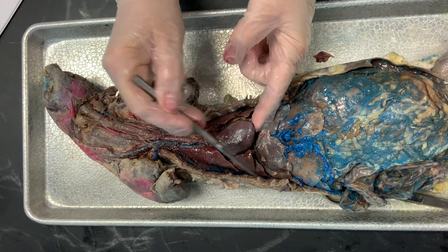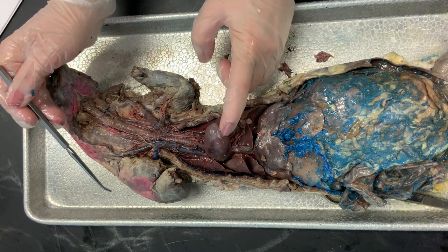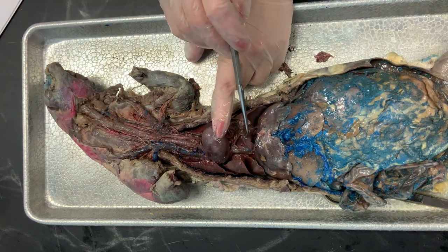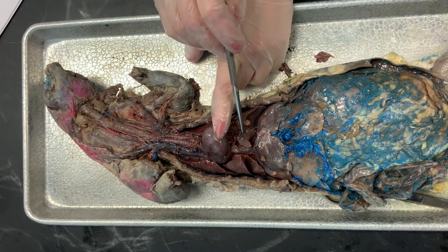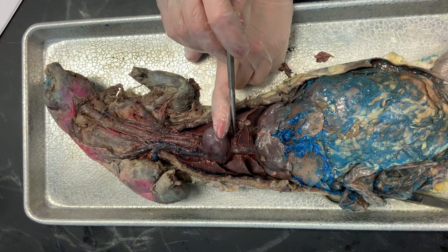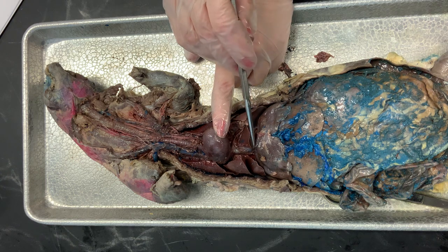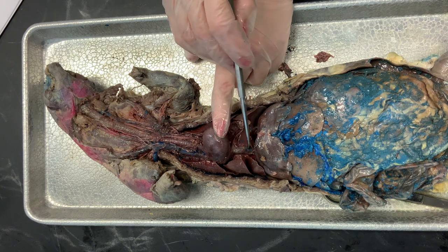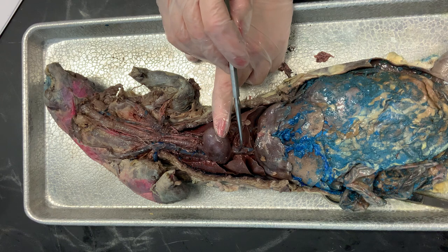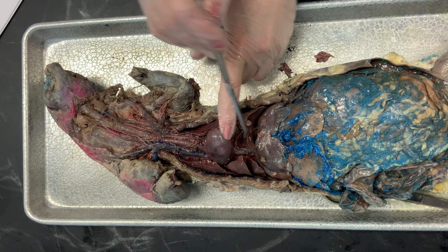If we lift the heart up just a little bit, there is another lobe — this is the accessory lobe. I'm wiggling it right here. That's the accessory lobe, right beside the inferior vena cava. You can see the inferior vena cava running right here at the bottom of the heart. There's that accessory lobe.